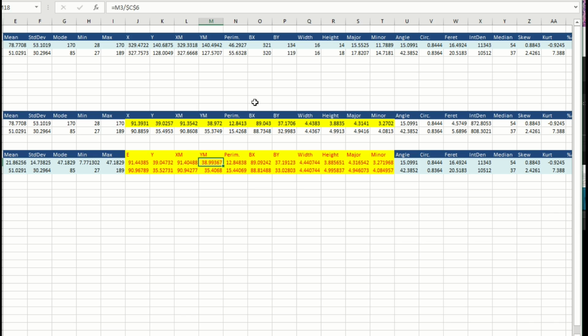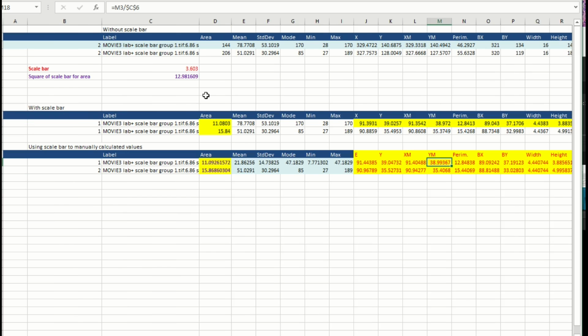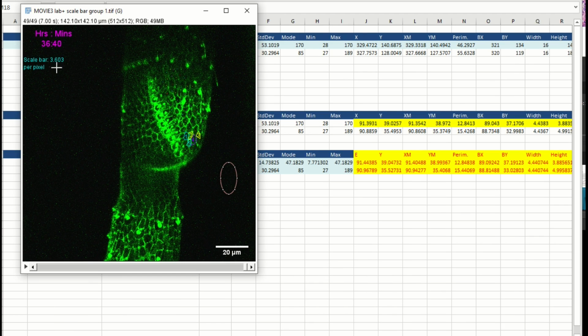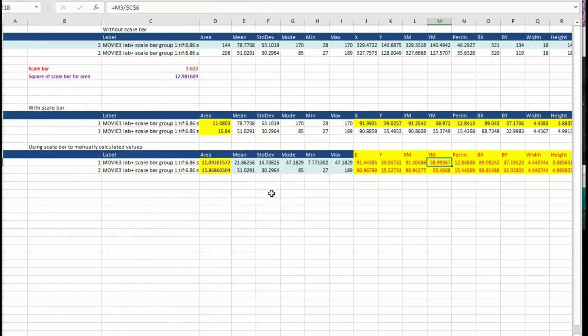Why don't we have exactly the same values? As I said before, this is why I gave you this scale bar. Every time you measure the scale bar, you're going to have a slightly different variation. If you always have the same scale bar, you are going to have the same value. Anyway, these differences are very small and not very significant, but I'm going to try to have the scale bar in all the movies, so it's easier for you.